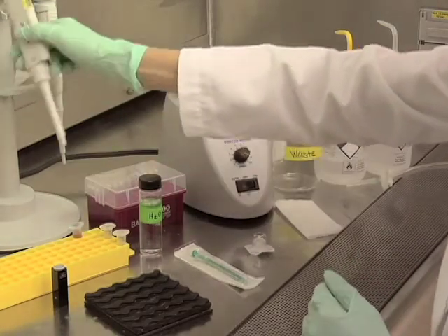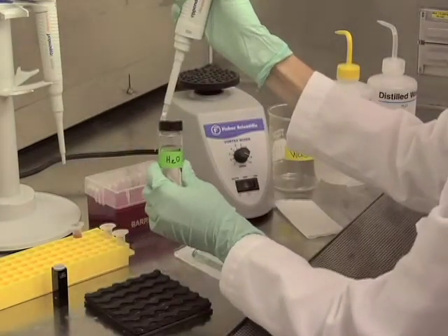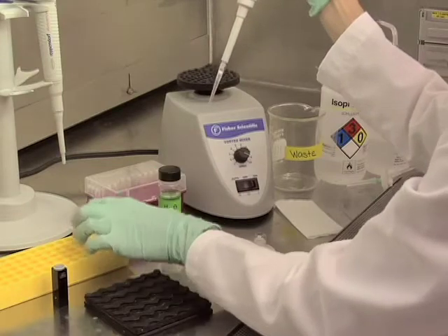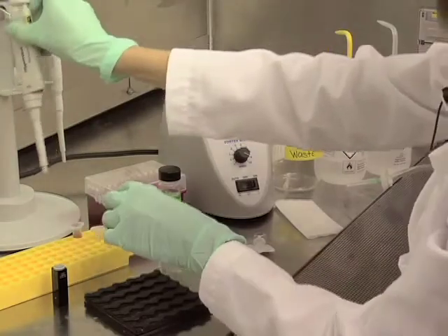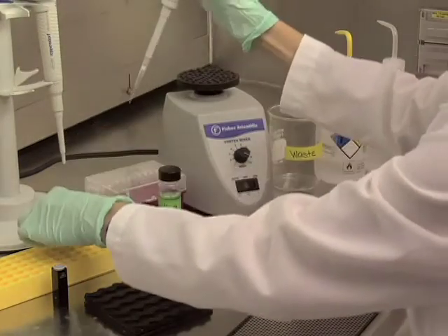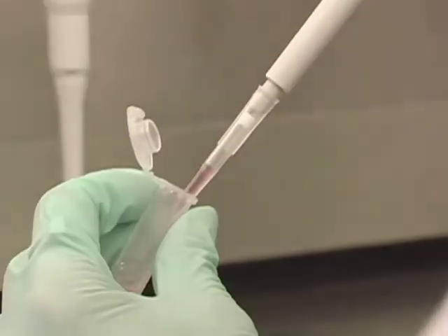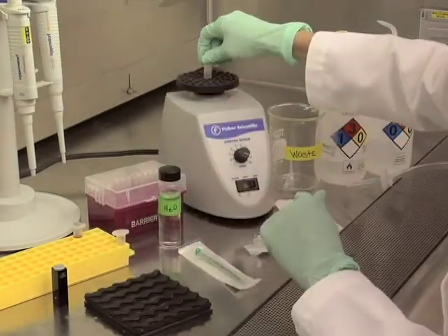To start, I will be diluting my sample 1:1 in my dispersant media. Our dispersant media for this demonstration will be water. Typical sample concentration is 1 mg per mil. This may be adjusted depending on your sample's scattering properties. Make sure that your sample is mixed well. I will then add my sample to the dispersant media to make my dilution. Mix your sample again after you make your dilution.